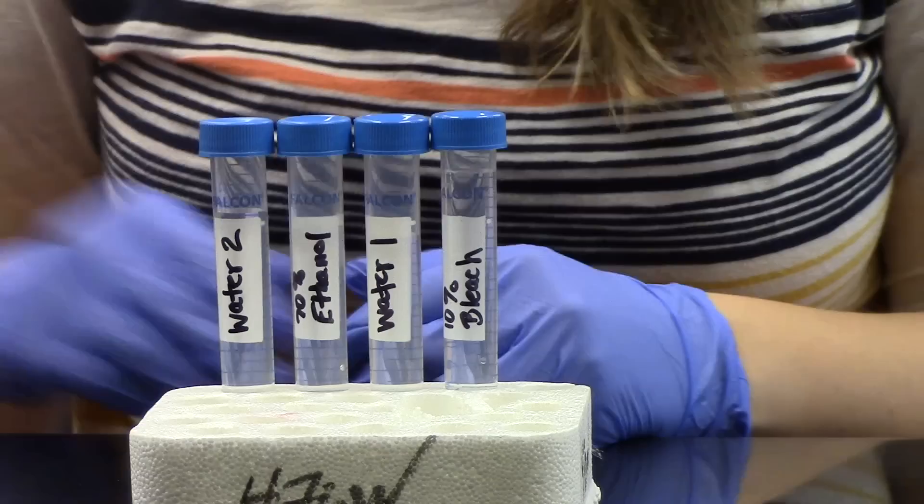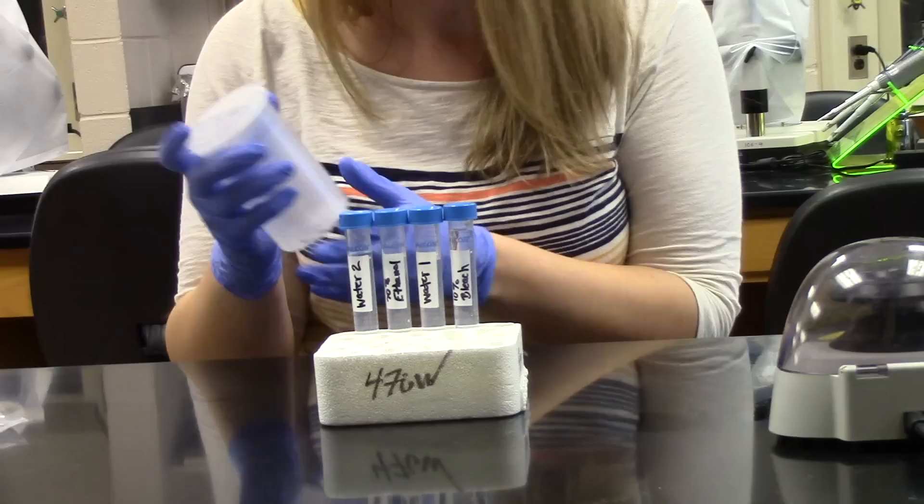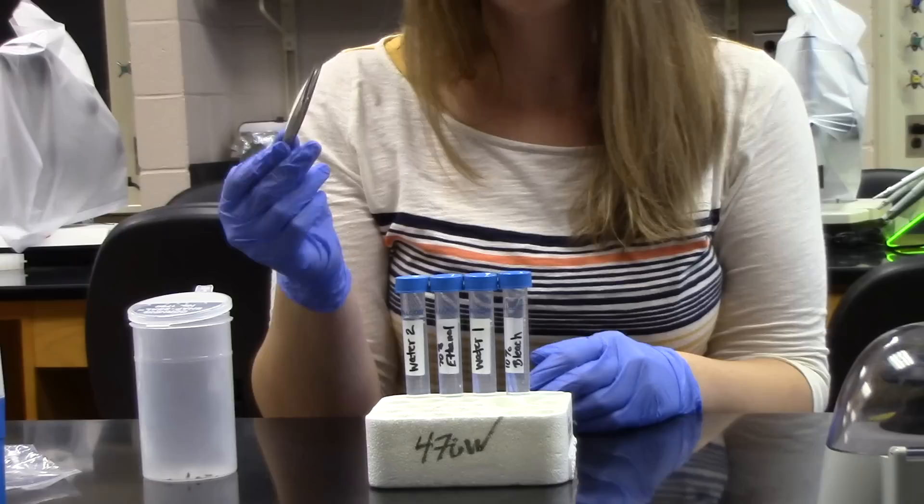So to do this, we have our beetles that have been frozen for us, and we have our tweezers. We want to sterilize our tweezers first by the same procedure that we sterilize our beetle with. So go ahead and open the tubes.